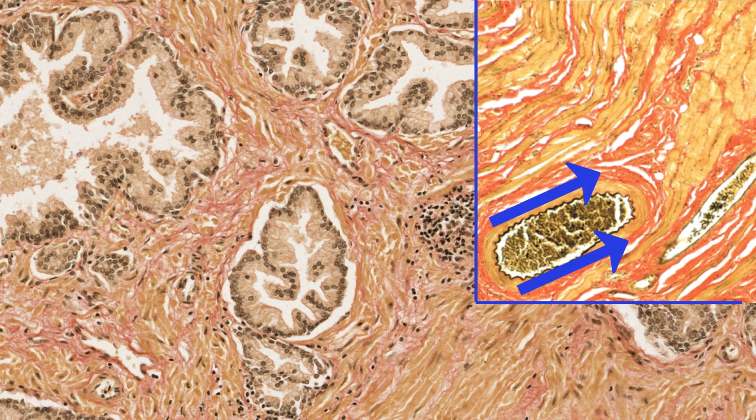So it's another example, like we saw earlier, with the trichrome stain distinguishing muscle from collagen. And they are two tissues that are often very hard to distinguish in normal hematoxylin and eosin stained sections. And that makes histology sometimes difficult to learn if you don't have the use of these differential stains.